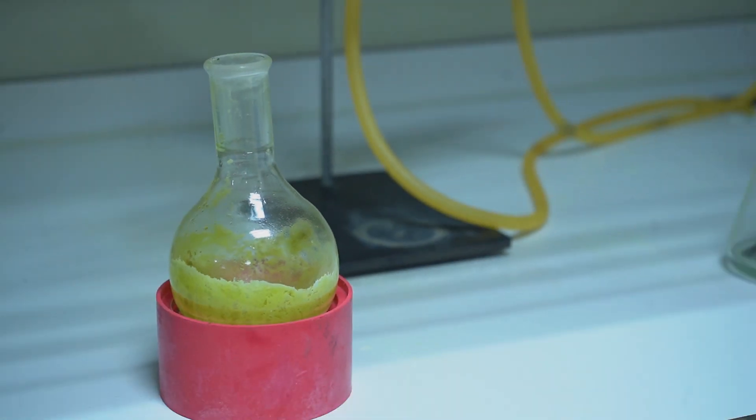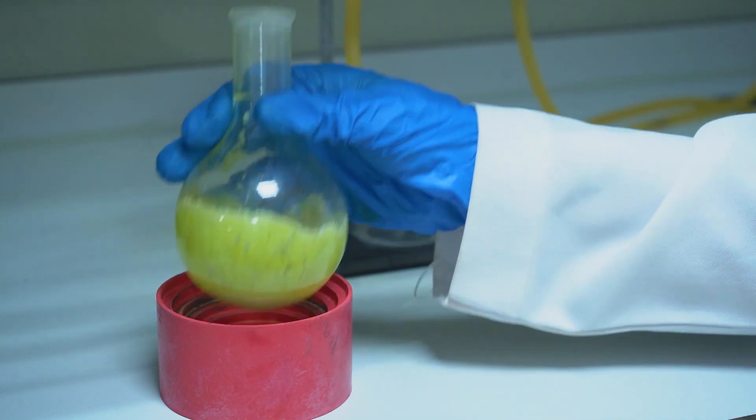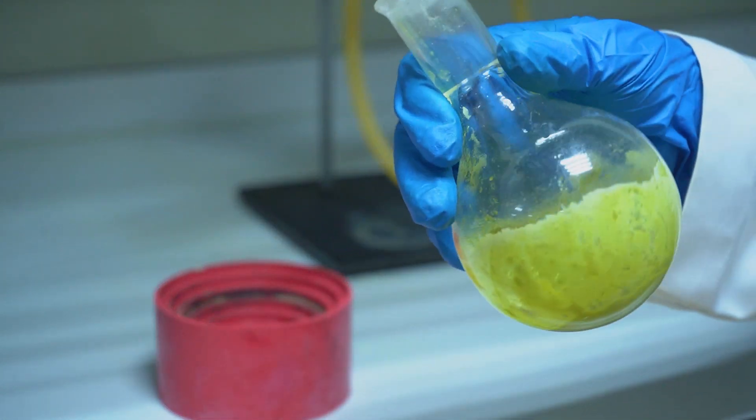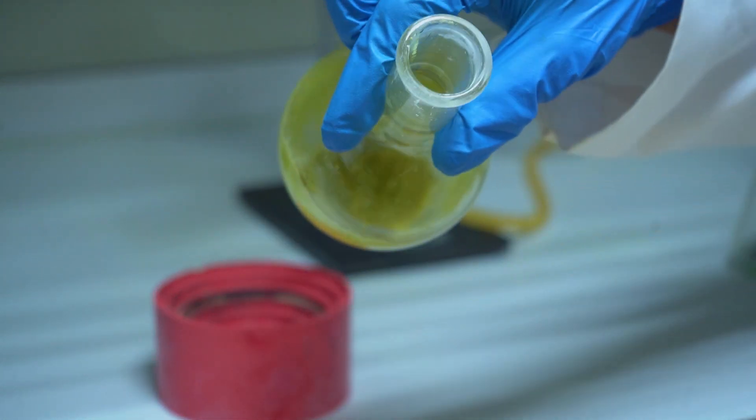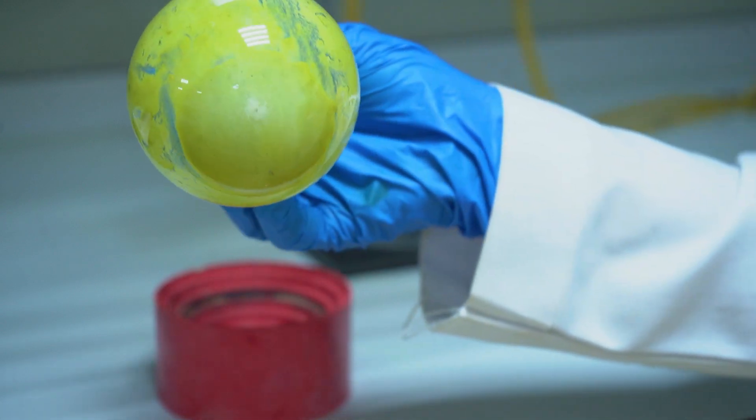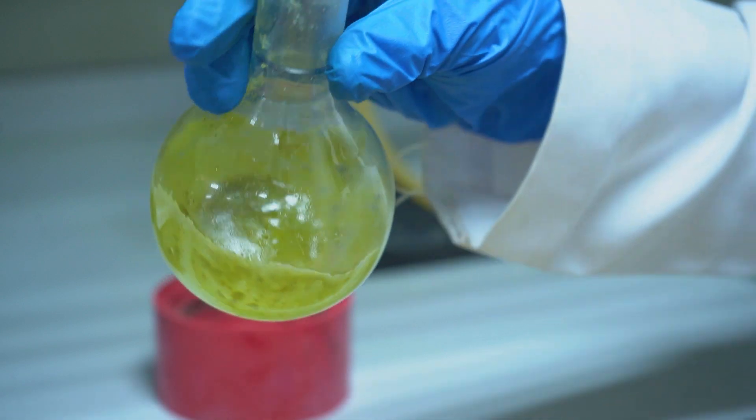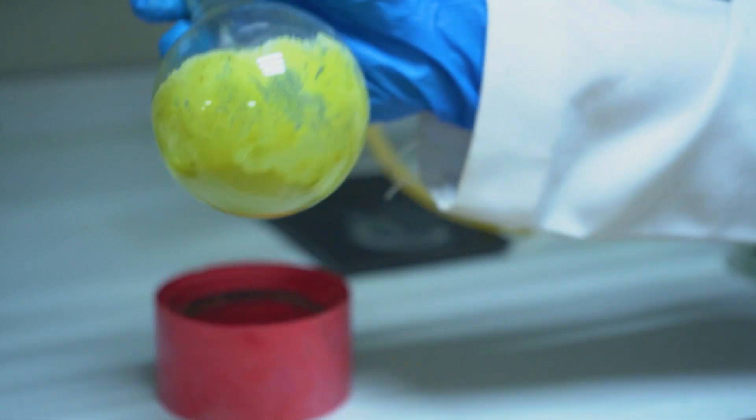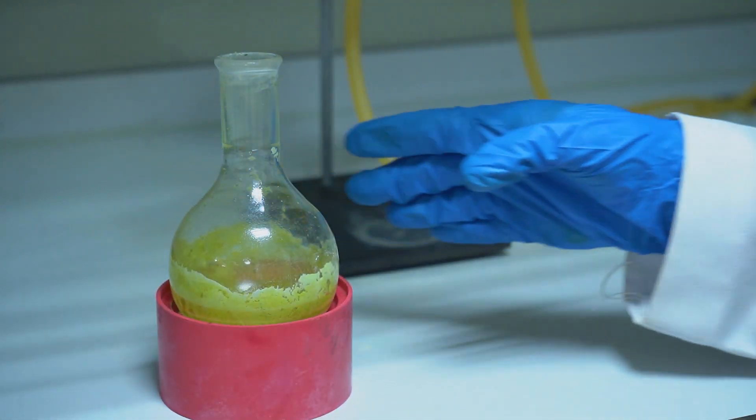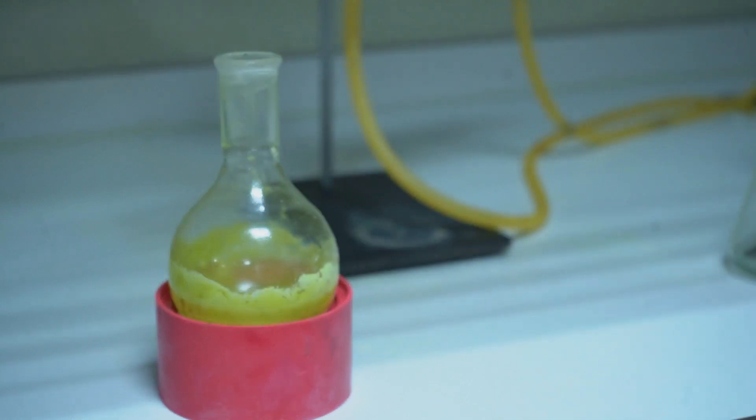So I will start to heat. Beneath the round-bottom flask, we have a very nice precipitate of ferrous chloride, which is pale green in color. So we allow the round-bottom flask to cool and store it in a clean glass vial.